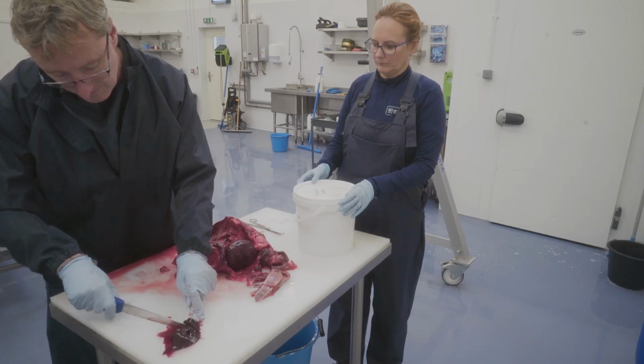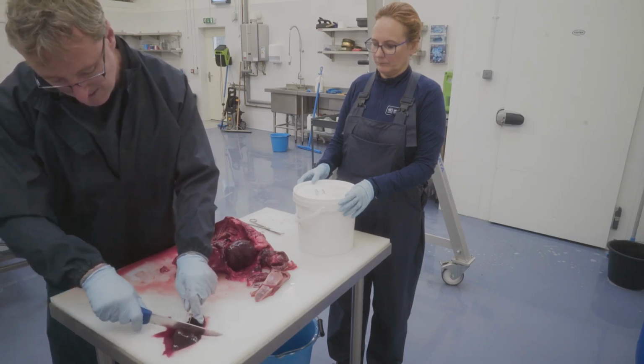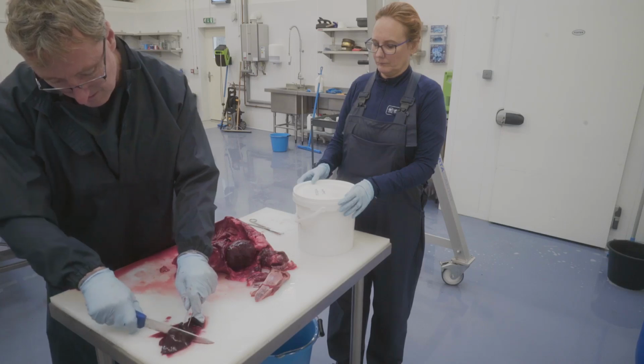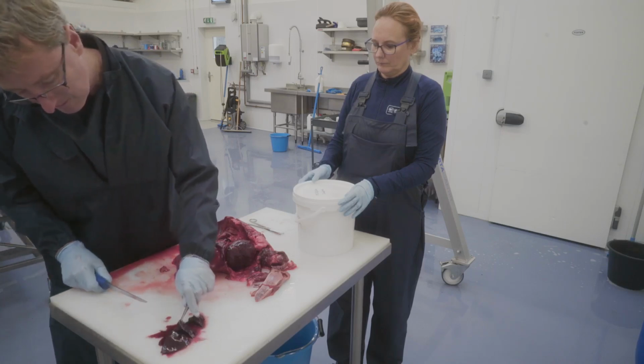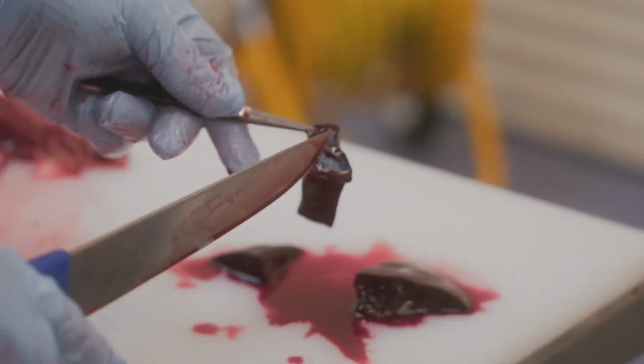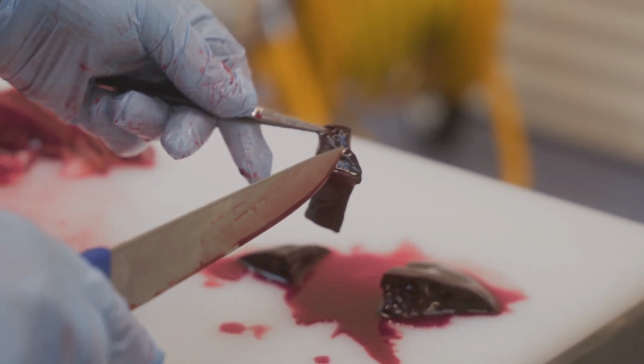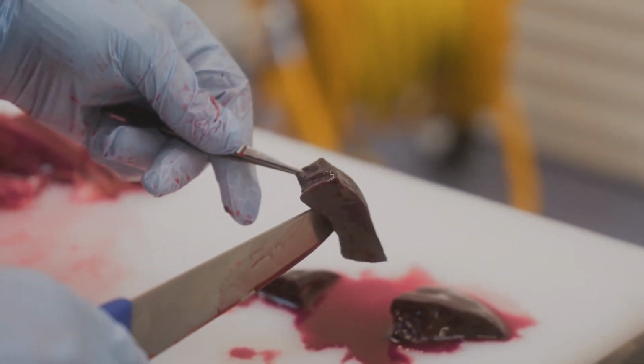Histopathology allows microscopic examination of tissues to identify and understand disease processes. To ensure good results, handle tissues gently to avoid introducing crush artifacts. Cut slices no thicker than 1 centimeter. Thicker pieces will not fix properly and will begin to break down.